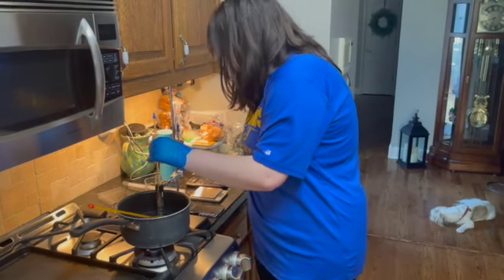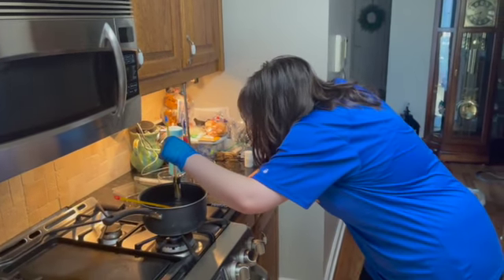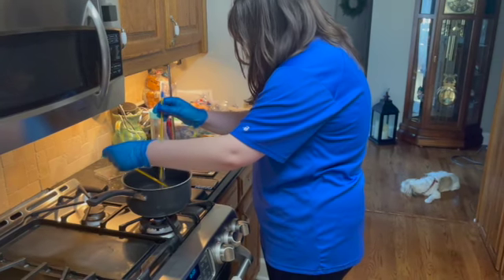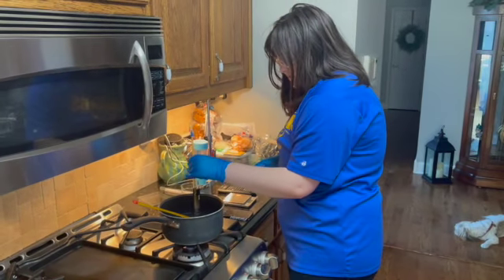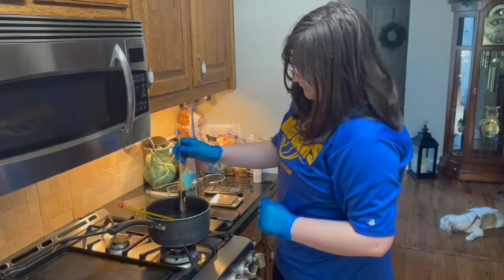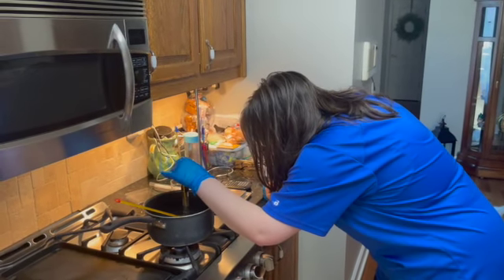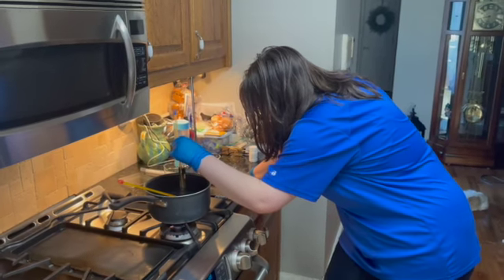Now I've got to turn back on my phone because it decided to turn off on me. But we are at minute 18, and our solvent is at 54 degrees Celsius and our hot bath is at 55. So it's been roughly around that this entire time, which is good because it is very close and within range of the melting point that we've looked up for para-dichlorobenzene, which is around 53, 54 degrees Celsius. So that's really good. And of course, human error is there, so that's why it's not exactly at 54, but it is as close as we can really get it at this point.